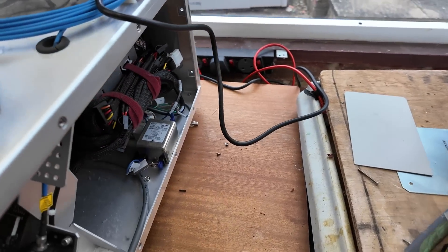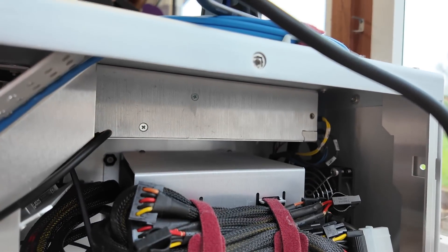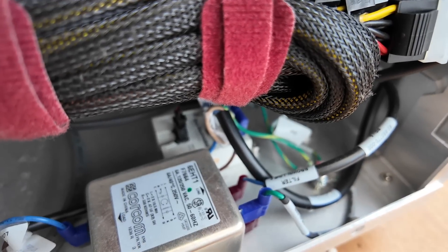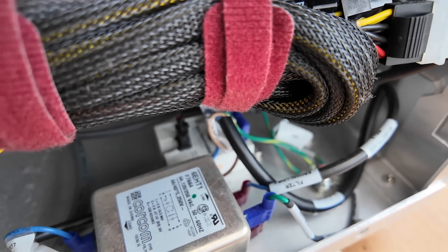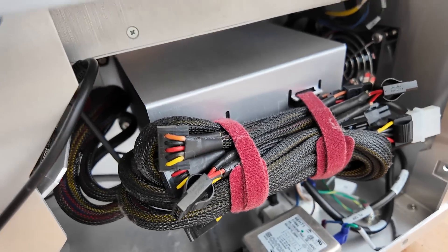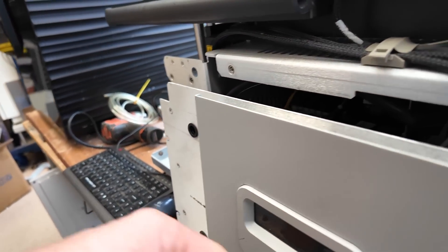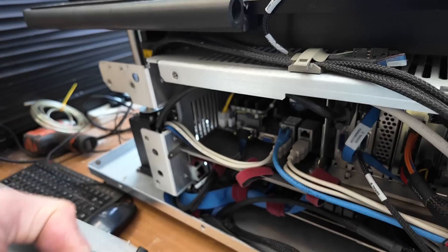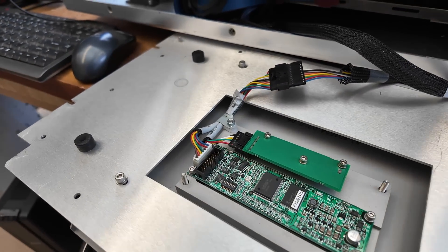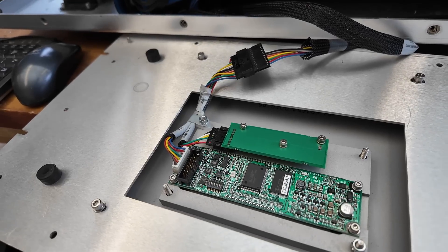Taking a general look around here — in here we've got a PC power supply and another secondary power supply for the motors and everything presumably. Down in here there's a solid state relay that controls the secondary power supply from the PC power supply, using the PC on/off switch. There's a little vacuum fluorescent display. I think this must have that OPGEN image pre-programmed into the display because that comes on as soon as it powers up.